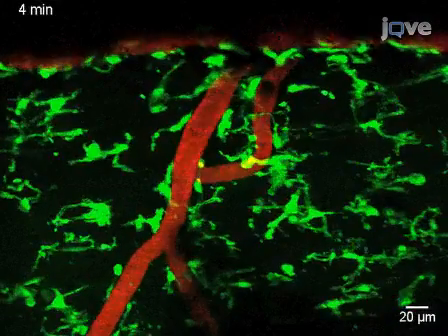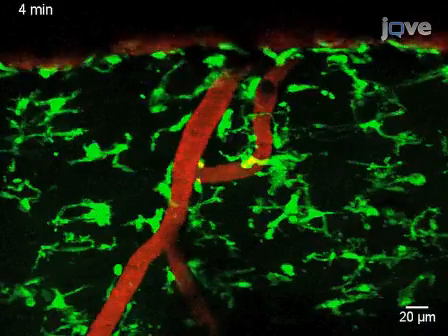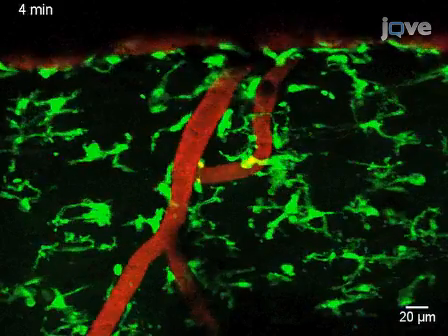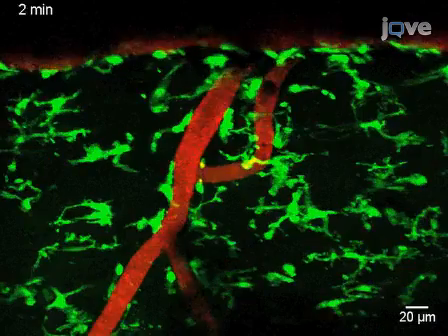Ultimately, results can be obtained that detail the dynamic behavior of cells and their interactions with other cell types or structures in the living spinal cord through time lapse in vivo imaging using two photon microscopy. The main advantage of this technique over previous attempts to image the spinal cord in vivo is that it generates raw in vivo imaging data that require no post-processing and can be immediately evaluated and used for further analysis.